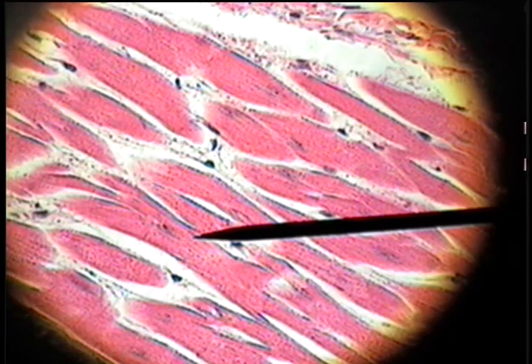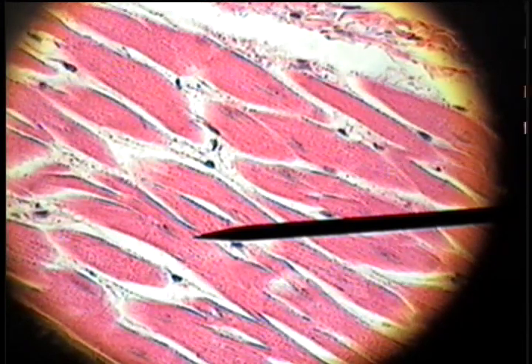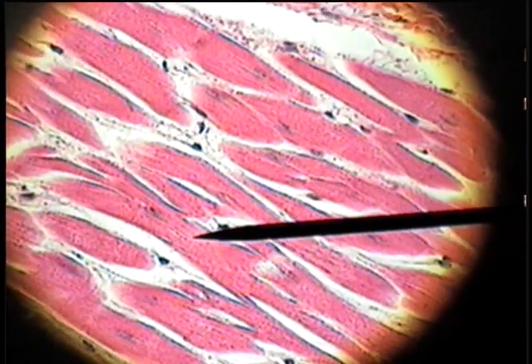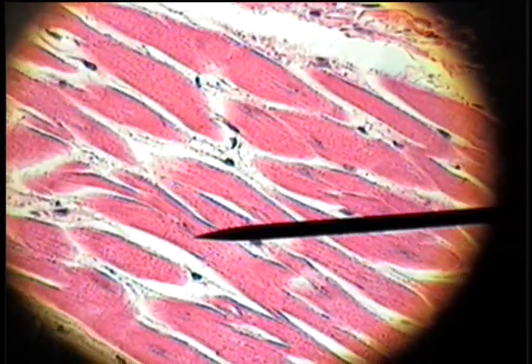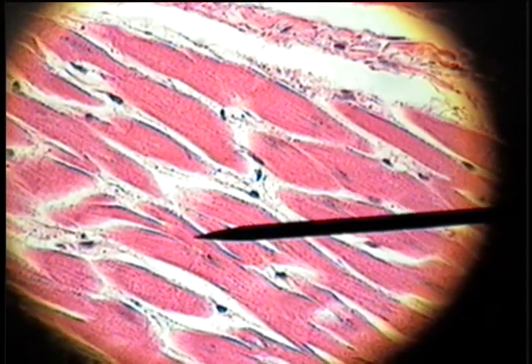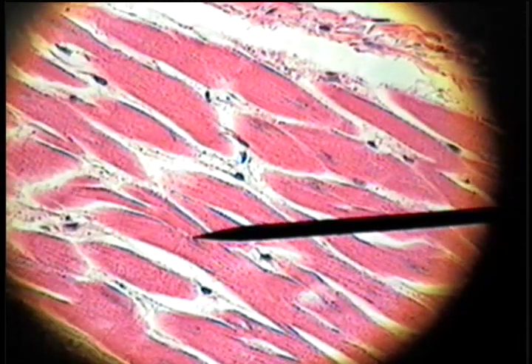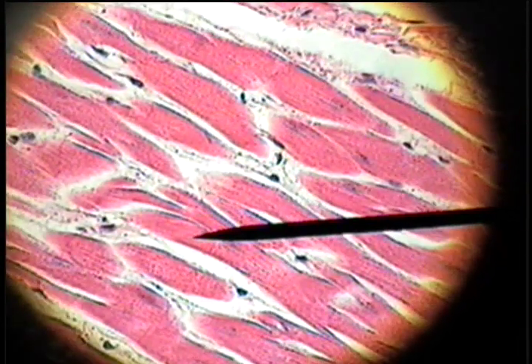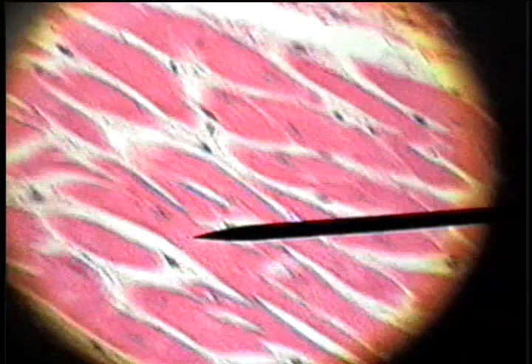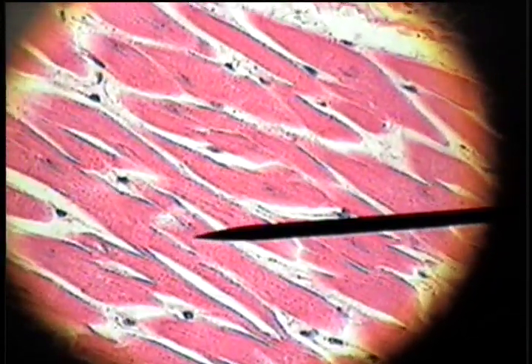Cardiac muscle, a second type of muscle, is of course found in the heart. It's characterized by cylinders of muscular tissue, but these cylinders, instead of being long and parallel as in skeletal muscle, they branch. Here's this cell right here, and it's branching — the Y branch right there — and it's branched at the other end here as well.